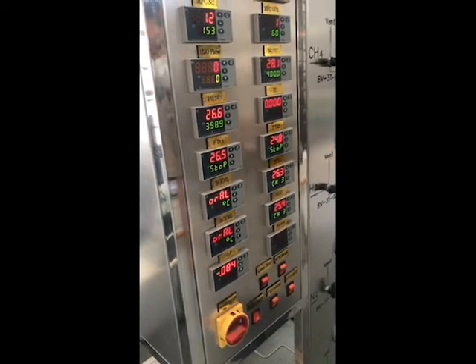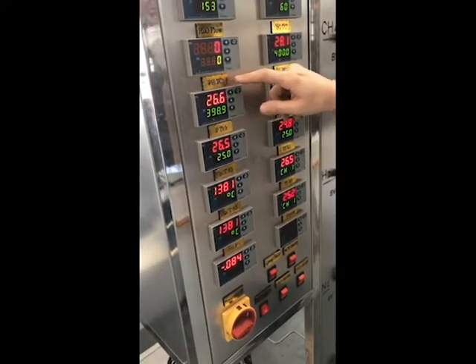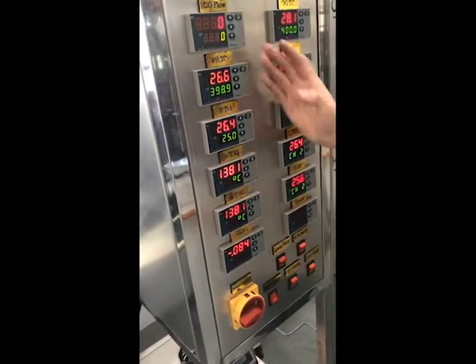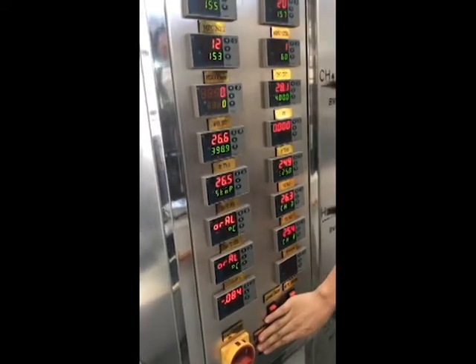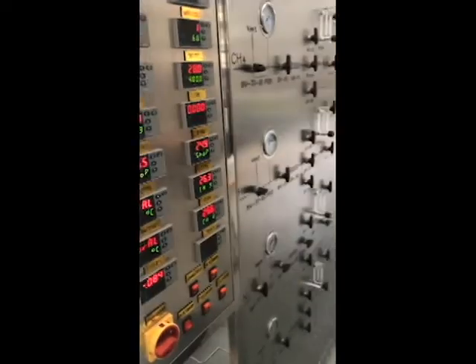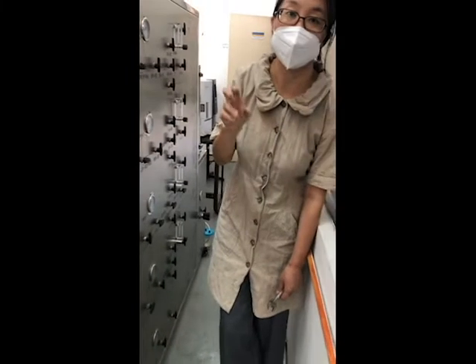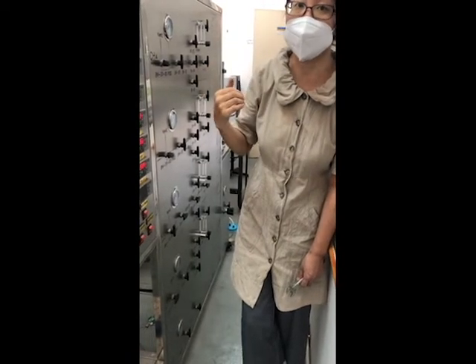So the first temperature you need to use is the PHTC, preheat temperature control. But you need to turn on the valve. Without turning on the heating valve, the preheat will never heat. This is to preheat your gas, to make sure your gas has been preheated before it is sent to the furnace. Because during reaction you may set the furnace at 700, right? If cool gas comes directly to the catalyst, the temperature may not rise to 700. It will be cooled down and cause an error.